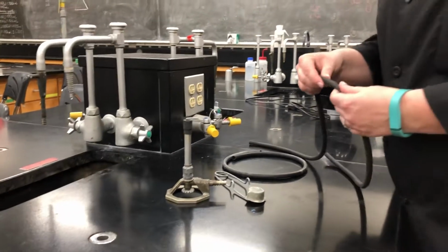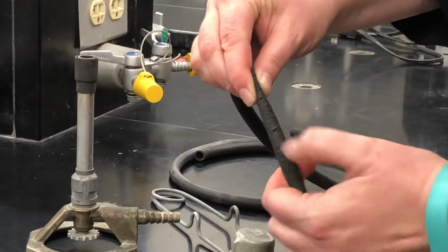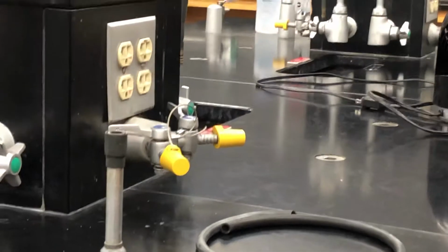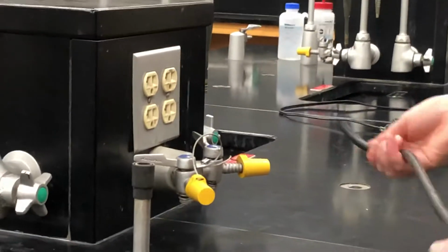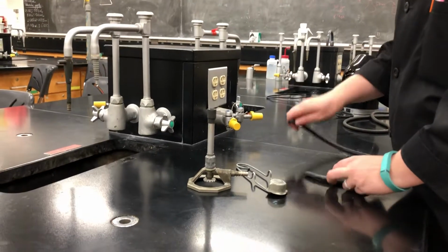So I have a bad one here to show as an example. It has cracks in it and it even has a small hole that's unsafe to use. So this hose is going to go directly into the trash can. The hose that I am using is completely intact and is ready to be used.